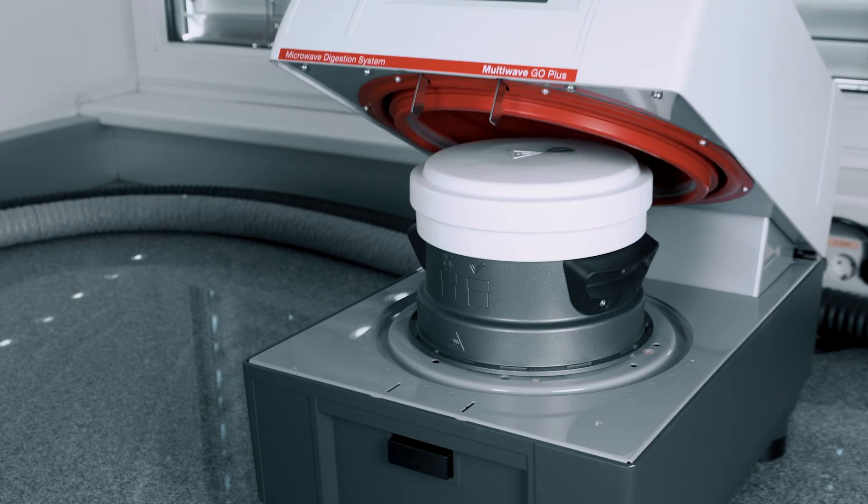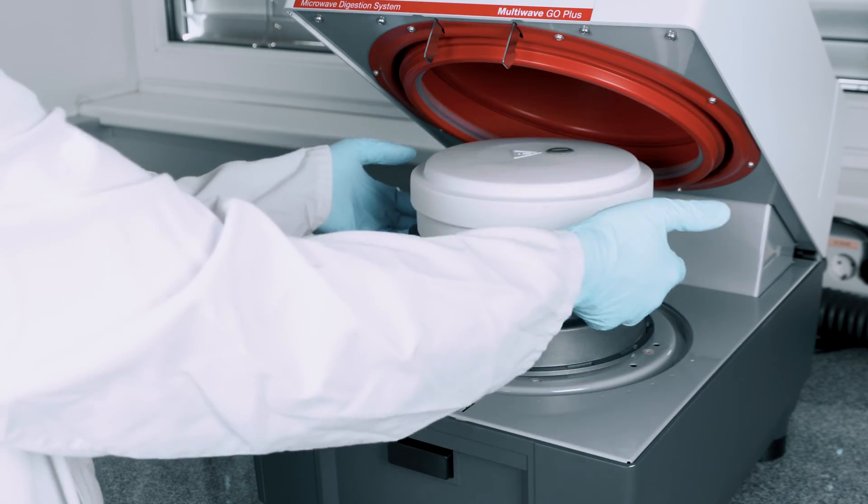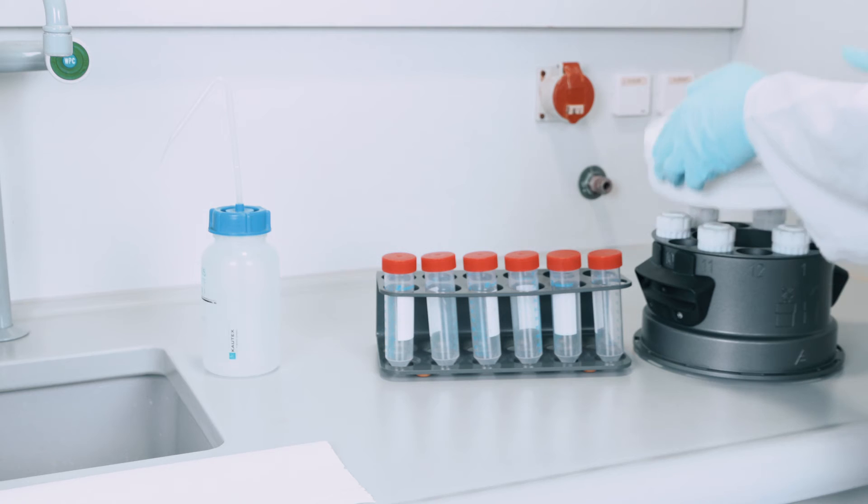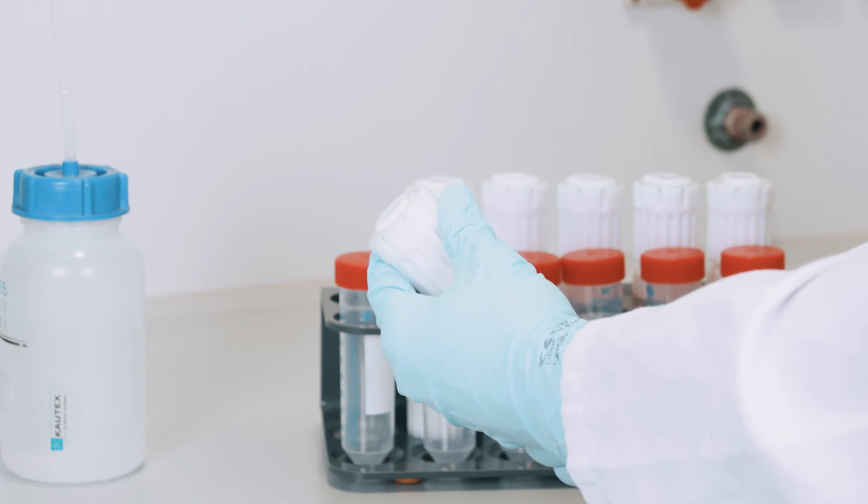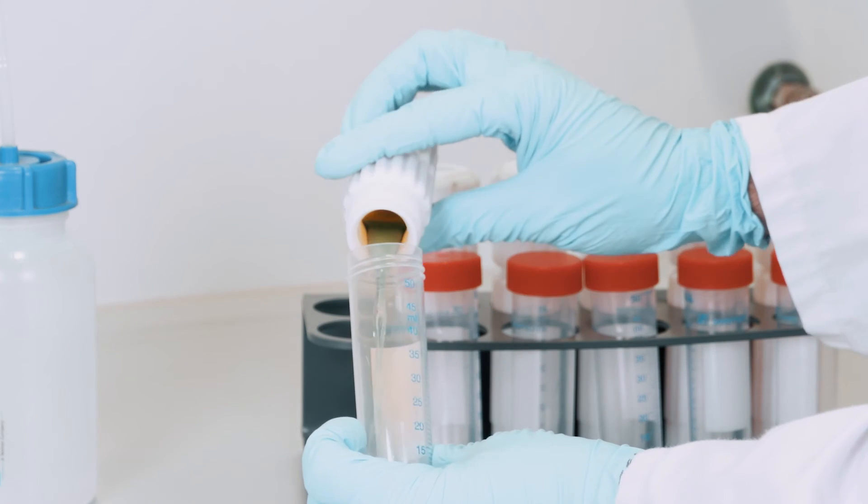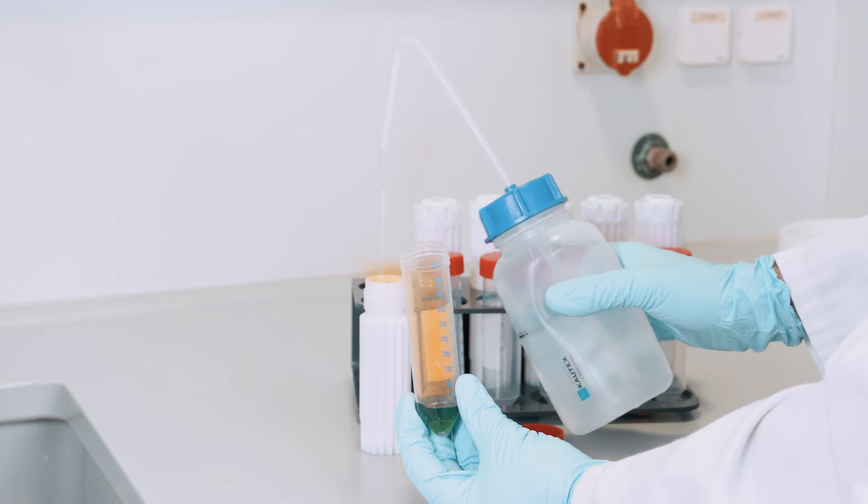Well, that's the process finished. We take out the rotor, take off the lid and pour the vessel contents into a test tube.